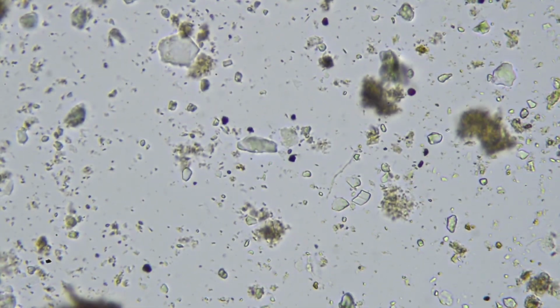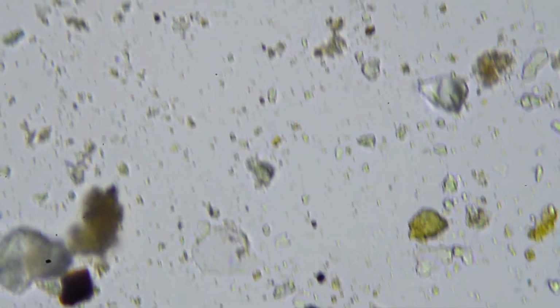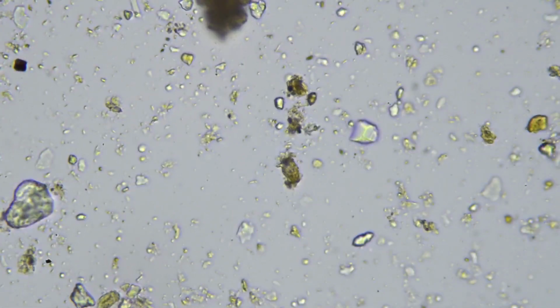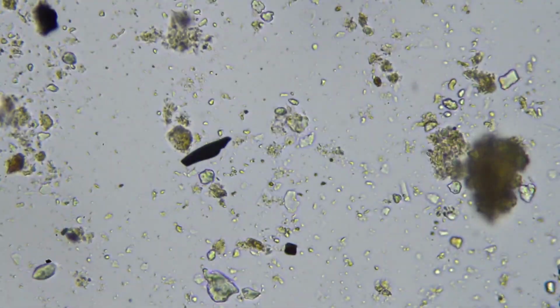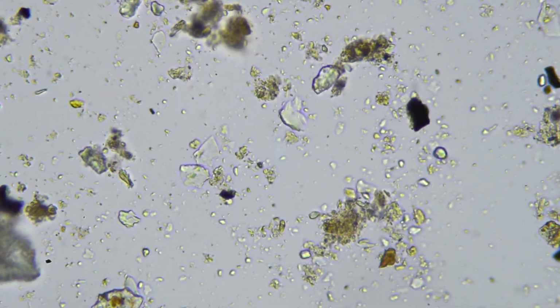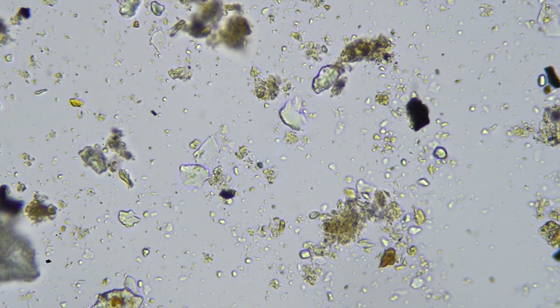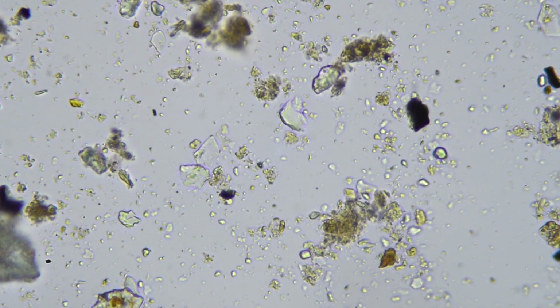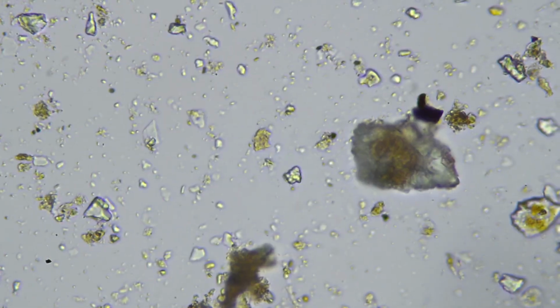There's some actinobacteria there, these little strands. Actinobacteria can be facultative, so they can be indicators of changing oxygen conditions. And we want our soils to be predominantly aerobic. We don't want them to be entirely aerobic, because that's obviously when things start getting oxidized. But by aerobic, I mean something like 4 to 6 parts per million oxygen. So it's lower oxygen levels than you would find just out in the atmosphere.